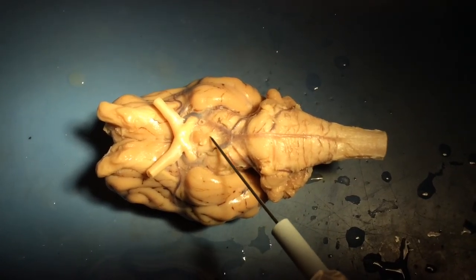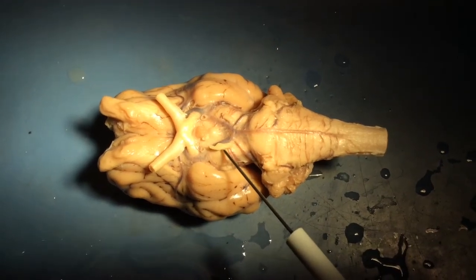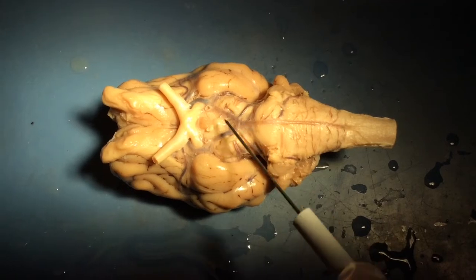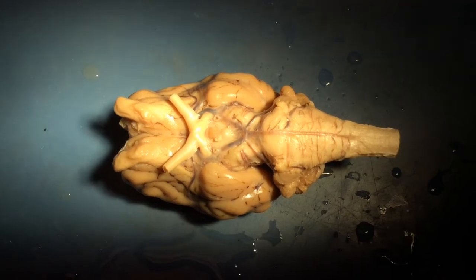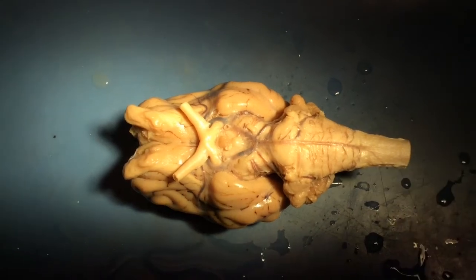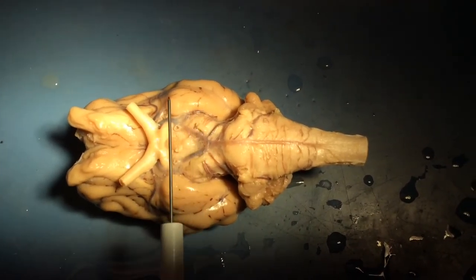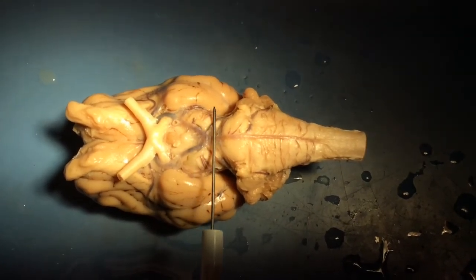Going back from the pituitary gland, if you have a careful dissection of the dura mater, the meninges that overlie the brain, you can often extract another prominent nerve, which also goes to the eye. This is cranial nerve 3, the oculomotor nerve, and it controls some movements of eye muscles and also some pupillary reflexes of the eye. The oculomotor nerve emerges from the midbrain, while the optic nerve emerges from the forebrain. So somewhere in between here and here, we're entering the bottom surface of the midbrain.